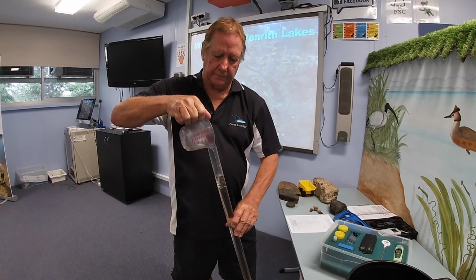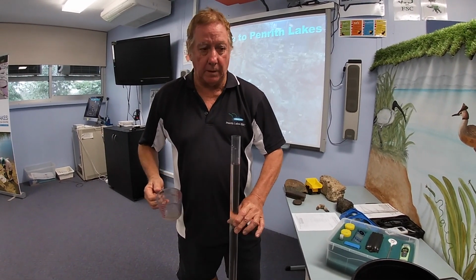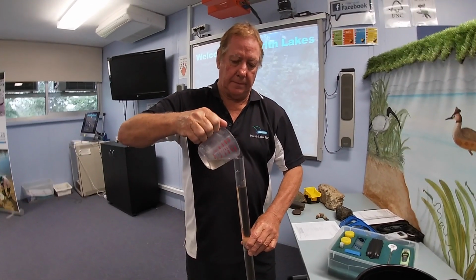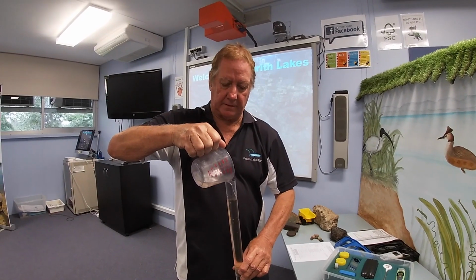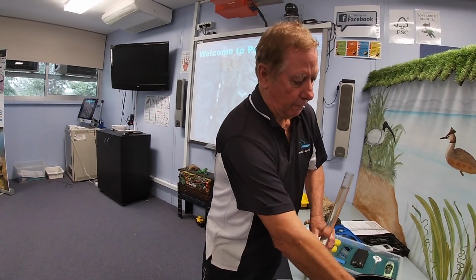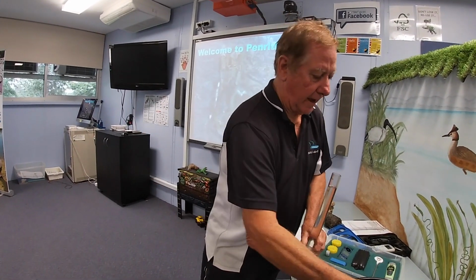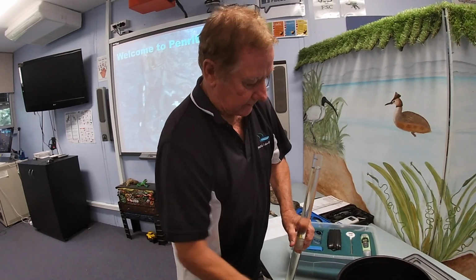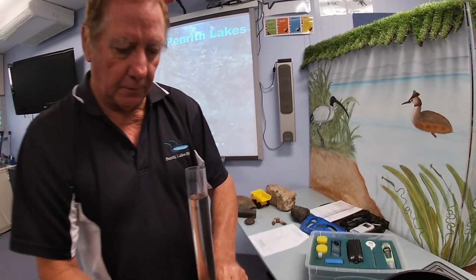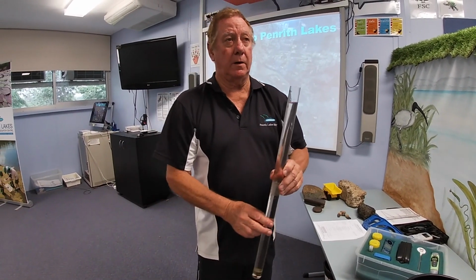my goodness, let's have a look. I'm looking through the top of the tube. I can still see the black and white quadrant. We are going a long way up this tube. In fact, once I get to a stage where we go past the 10 for our instruments, there's the 10, and there it is. I'm looking down through there. I can just see the black and white disc.